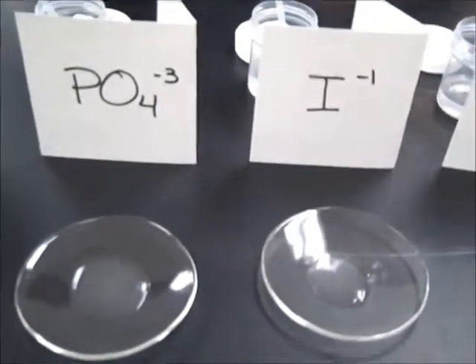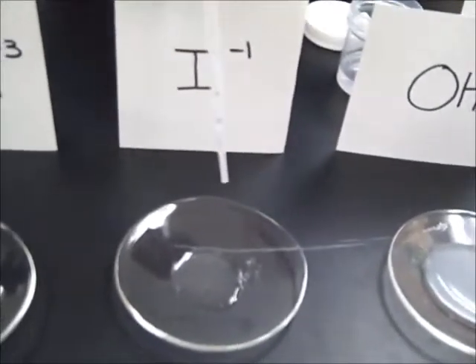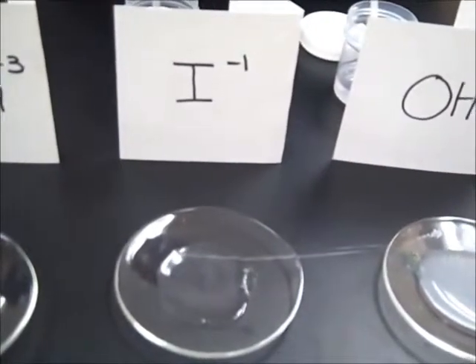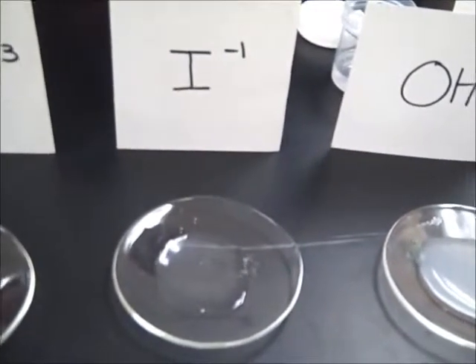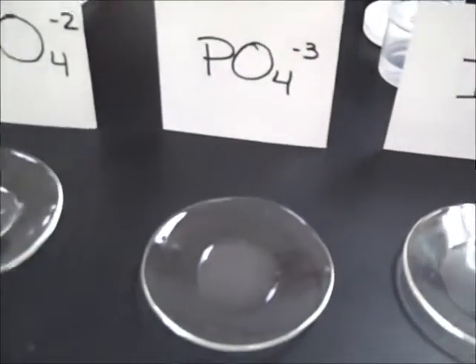That's a good word, intense. See, thank you. And then the barium and the I ion, the iodide. Yep. Nada. All right, Nick, your turn.